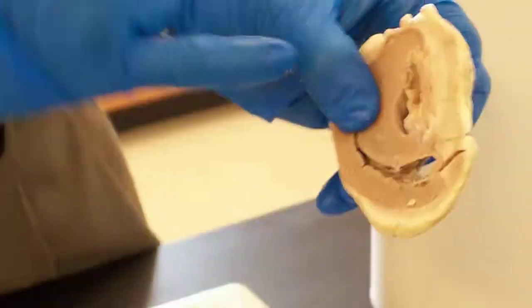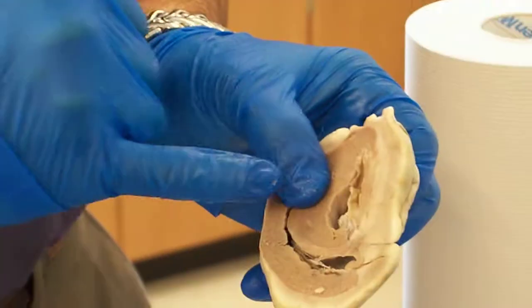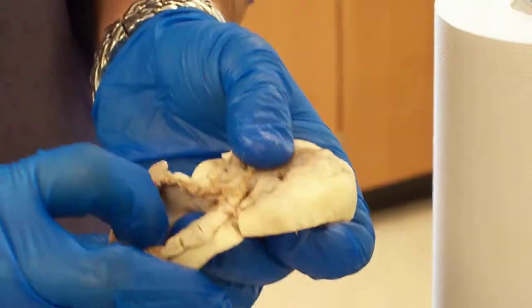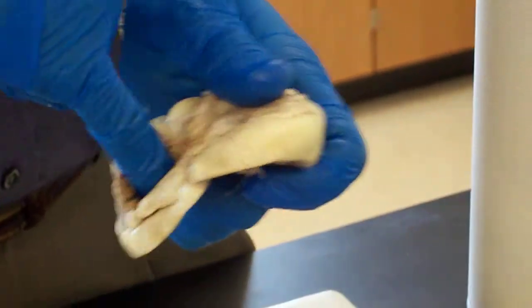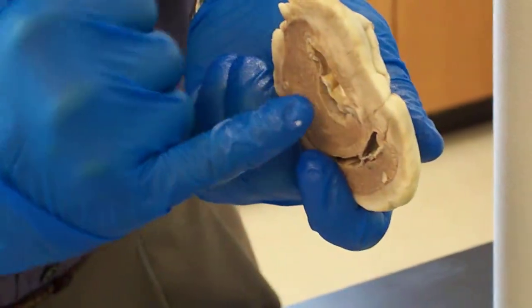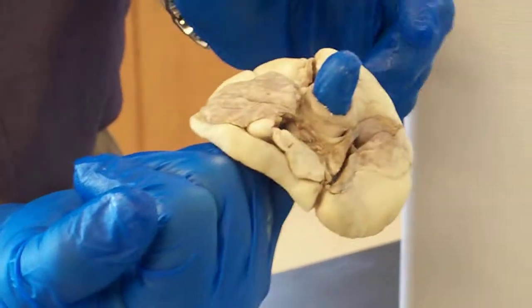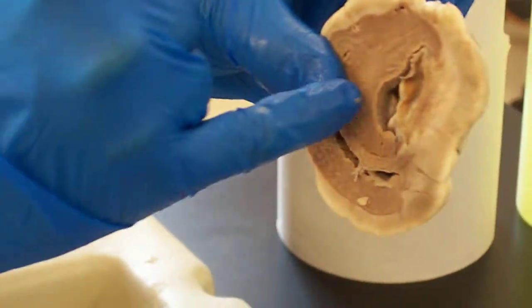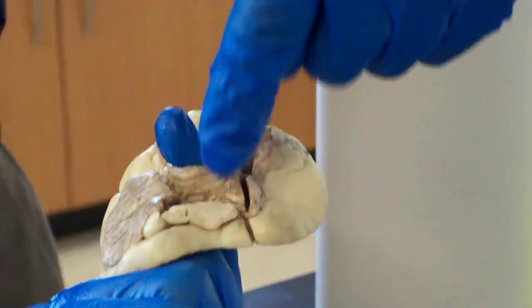Going to the other side, this will be leading into the left atrium. Here's the bicuspid valve — this chamber right here is the left atrium, which drains down into the left ventricle. The only way out of the left ventricle is through the aortic semilunar valve, which leaves the left ventricle and makes its way out the top, where the aortic arch would branch around.